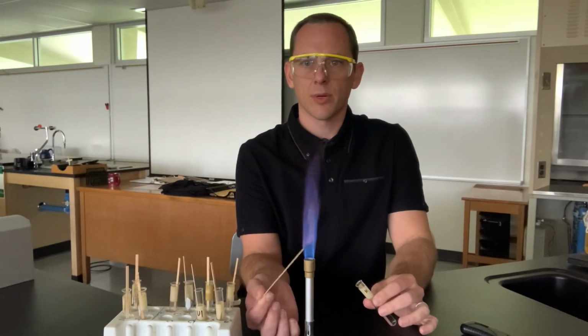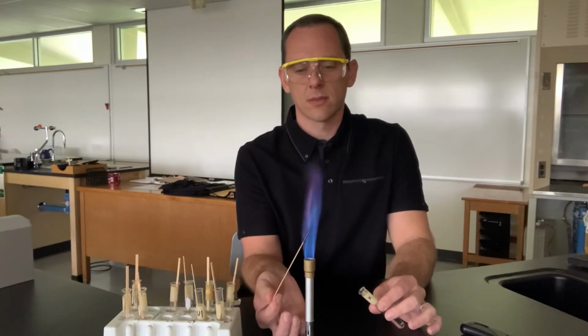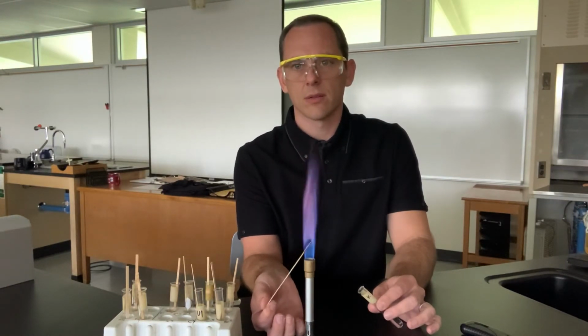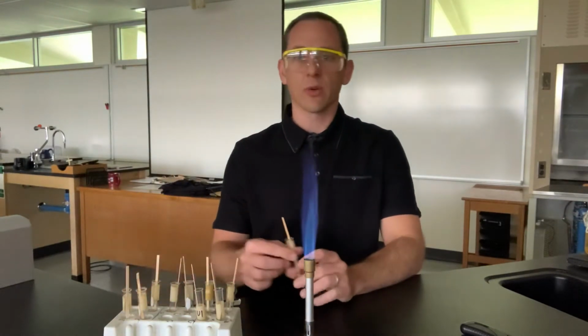It's getting real pale. Dip it again. Very pale. That was the potassium. Next we have sodium.